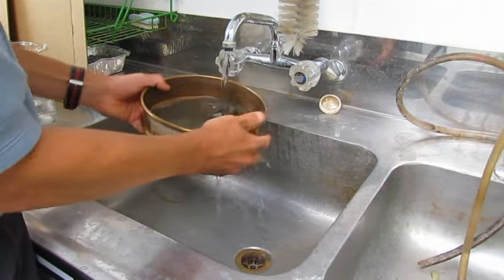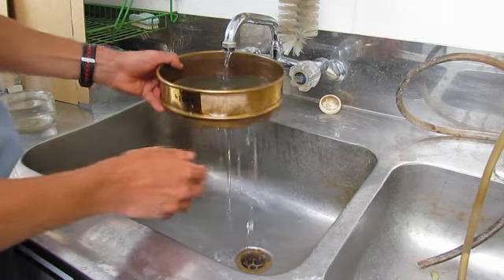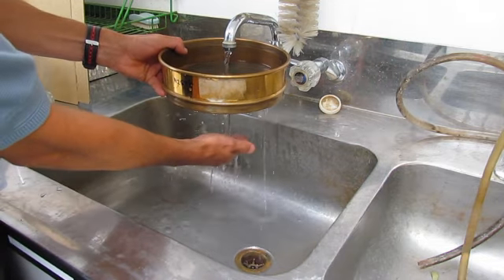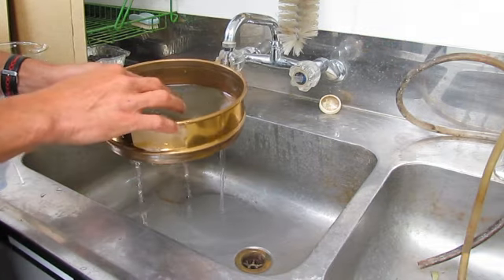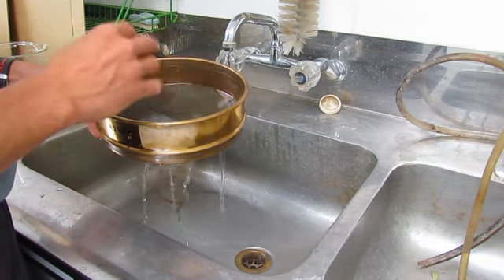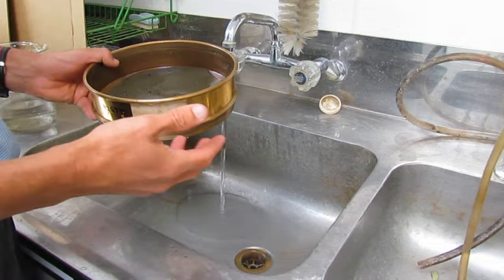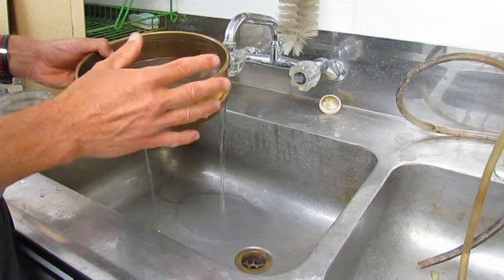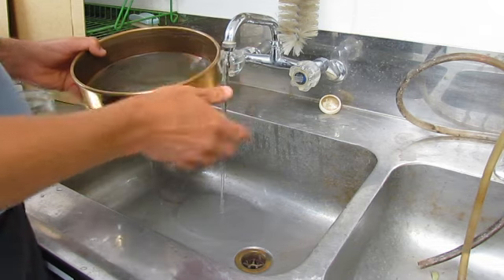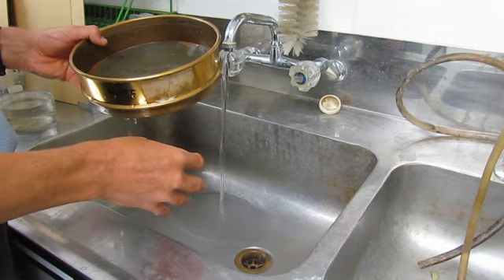So we've got to the point now where we've washed it through the sieve until it's running clean. There's no more silt and clay coming out the bottom, and what we do is take that sand out, dry it, and then pass it through the stack of sieves in a normal dry sieving process and work out the weight difference, which will be silt and clay. Then we add that into the calculation and reporting of the results.